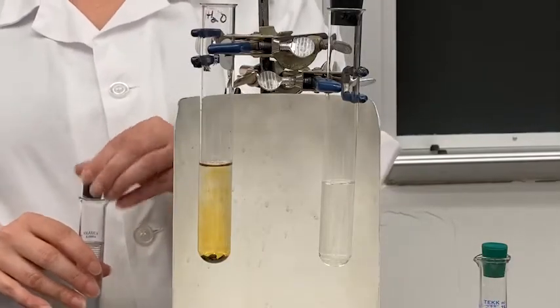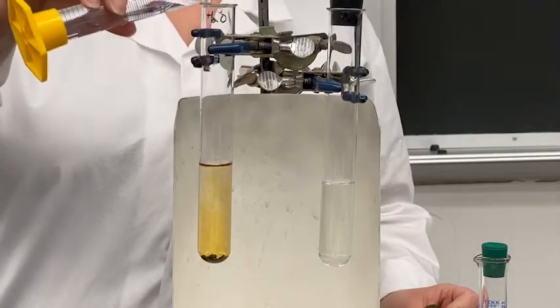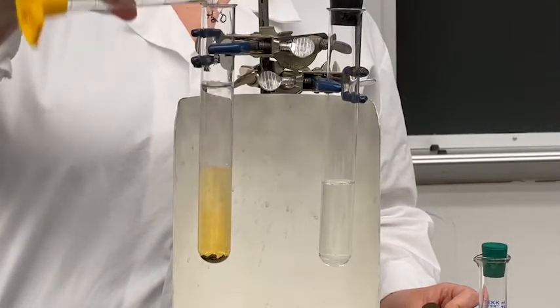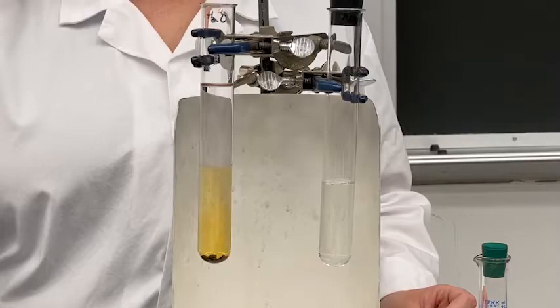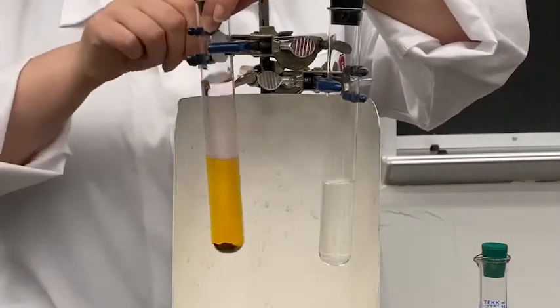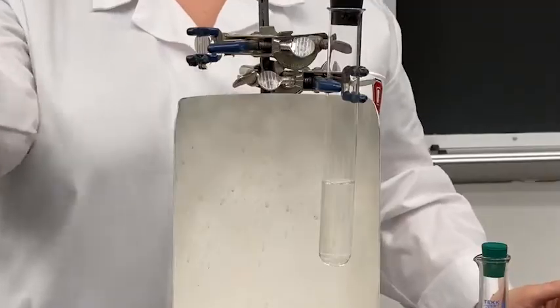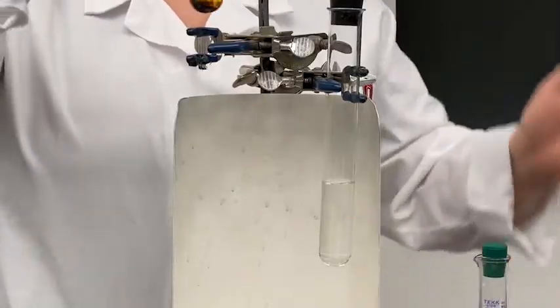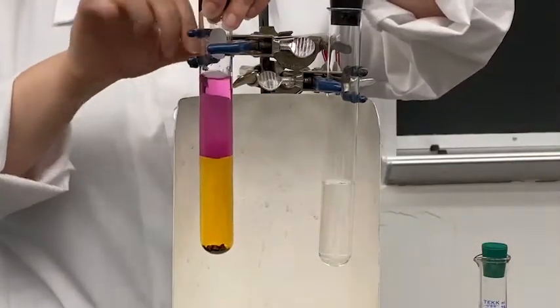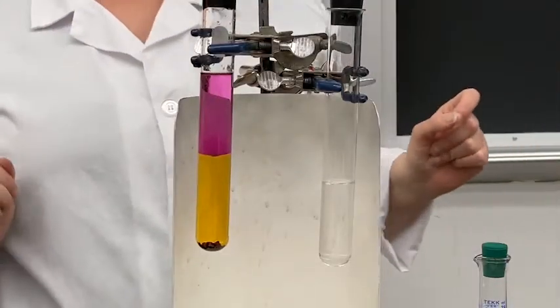Now I'm going to add some hexane. Hexane, being a nonpolar solvent, the iodine should dissolve very easily into it. To help it mix, I'm going to take it out and shake it. You can see from the bright purple color up here that the iodine has dissolved in the hexane.